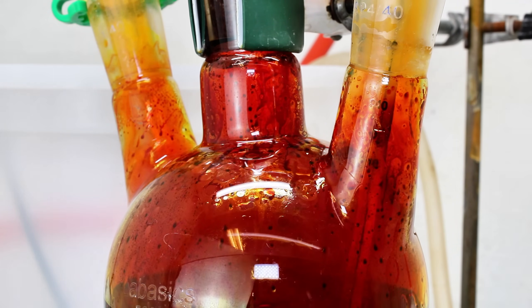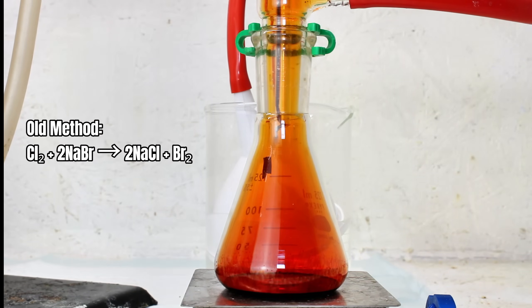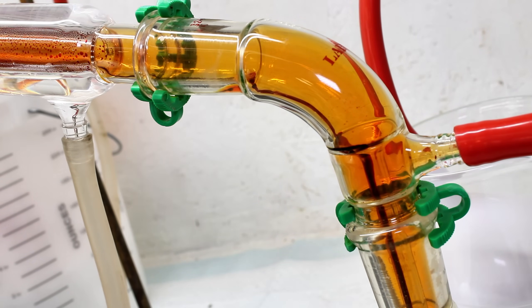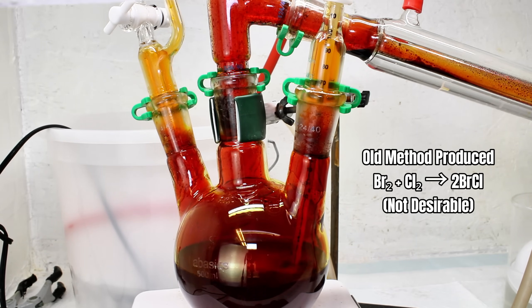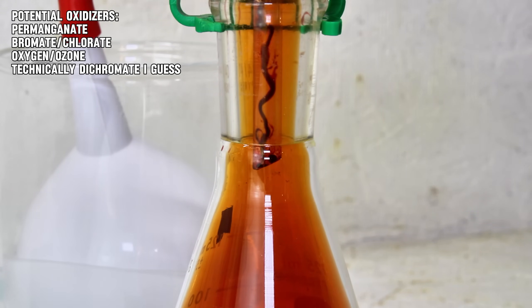The mechanism here is somewhat more complex than the method I showed last time. Back then, I simply reacted chlorine with sodium bromide, and since chlorine has a stronger affinity for sodium, they simply replaced each other, forming sodium chloride and bromine. The issue with this method is that it requires working with chlorine gas in addition to bromine, or the messy formation of chlorine in situ, which is the route I took. This method also likely formed messy bromine monochloride gas, which is quite dangerous on its own and likely reduced my yield significantly. The method I show here is much cleaner, resulted in much higher yields, and could be done with any number of oxidizers instead of peroxide, such as potassium permanganate.